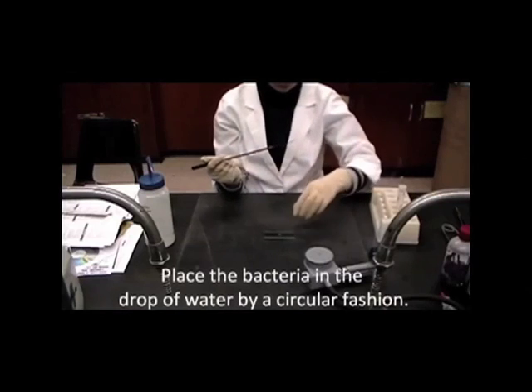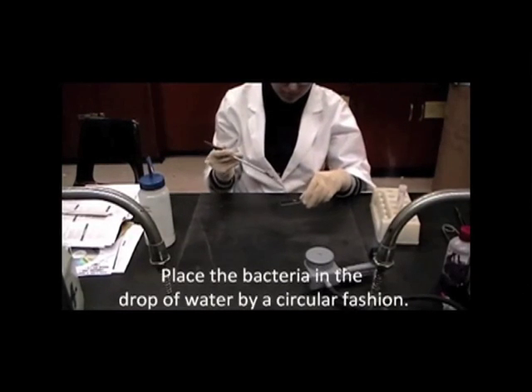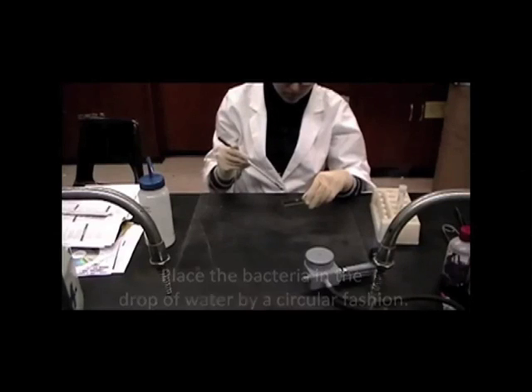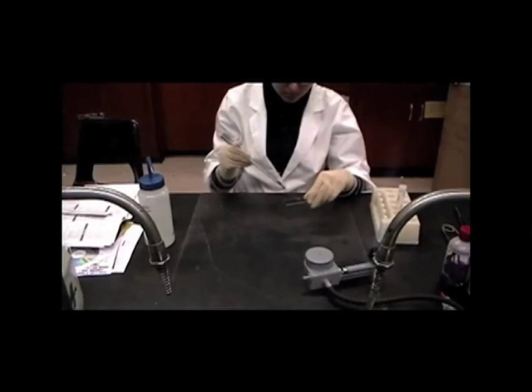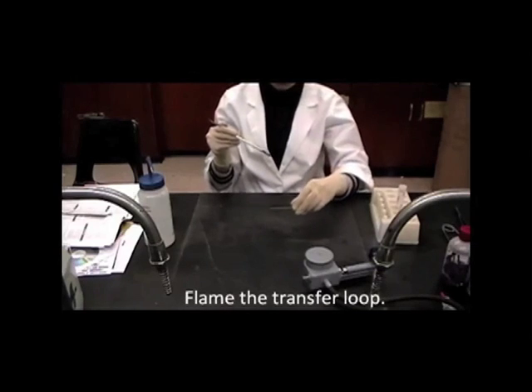And then placing the bacteria in the drop of water in a circular fashion to make a milky preparation. The milky preparation is apparent to the individual doing the heat fixation procedure. The transfer loop is then flamed.